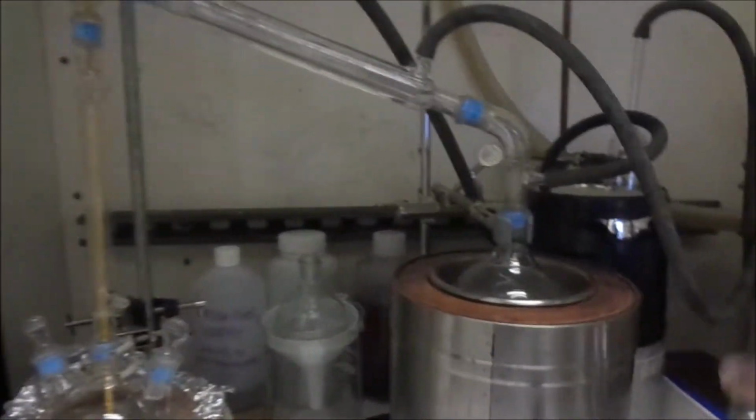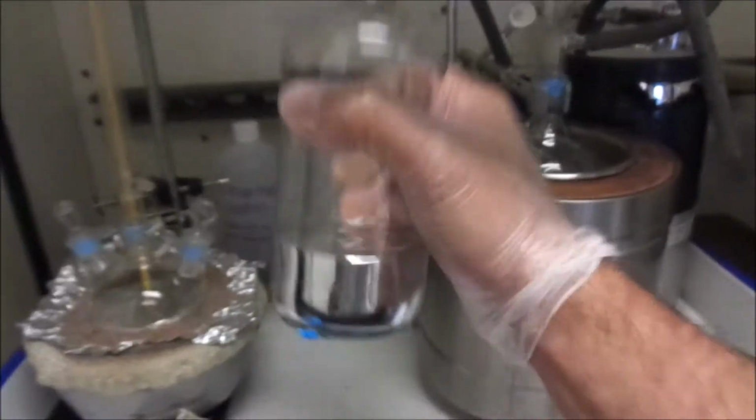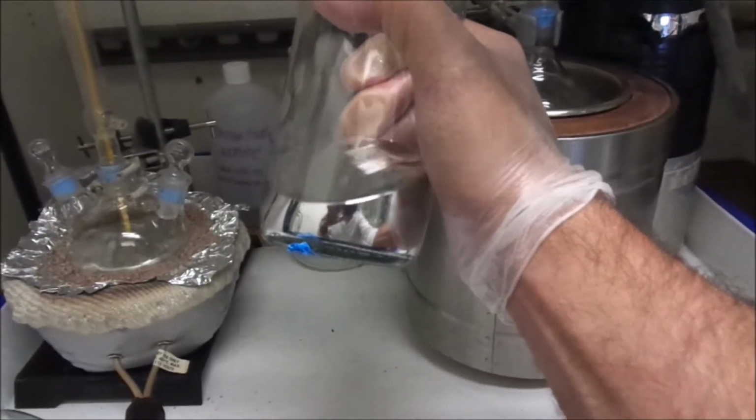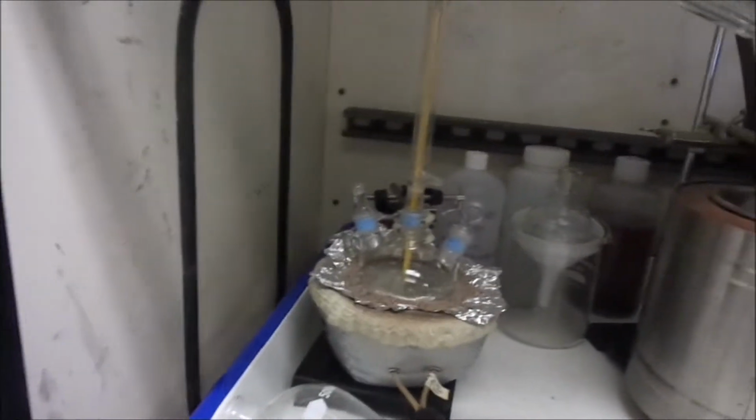Now, I could not fit it all in. In fact, even though I did overfill that distillation vessel a little bit, there's still a good chunk of the first distilled mercury. So this will be a double distillation, this time with a refractor.